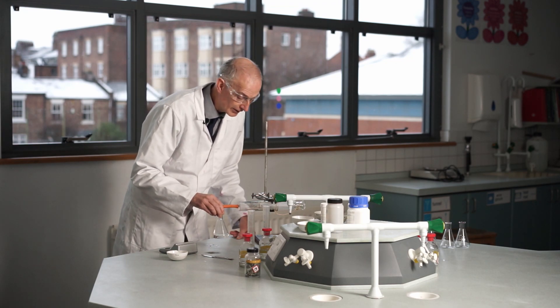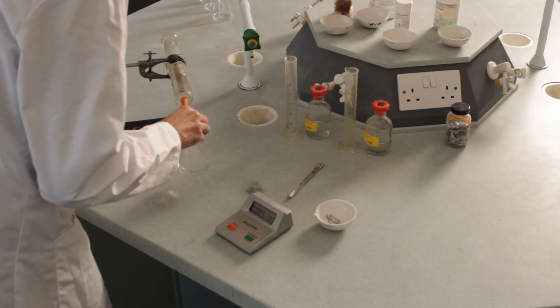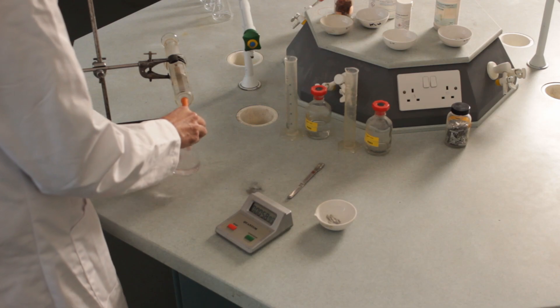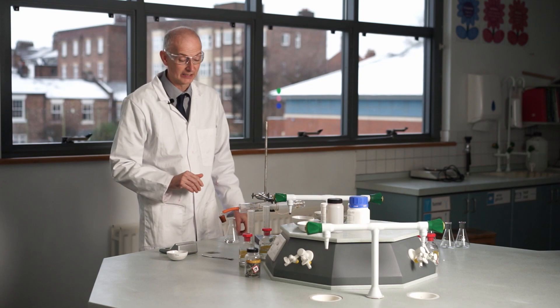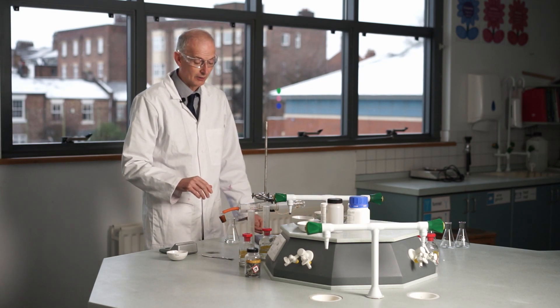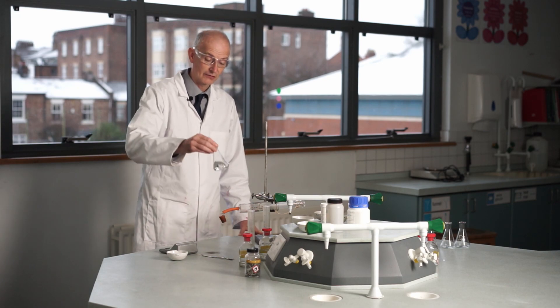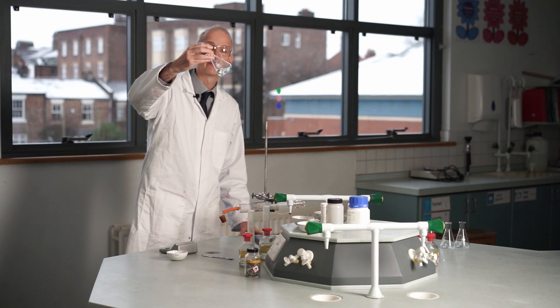Okay, so the volume we've got there is 20, 40, 60, 70, 75 centimeters cubed of gas in way less than a minute. Okay, we're up to the minute now. Okay, so that's a minute and we've gone 75 centimeters cubed, but it actually got there easily within 30 seconds. Okay, so a much quicker reaction. I think everybody can see that, but it did actually stop. And if I hold it up and swirl it, perhaps you'll be able to work out why it stopped. Can you see any magnesium in there?